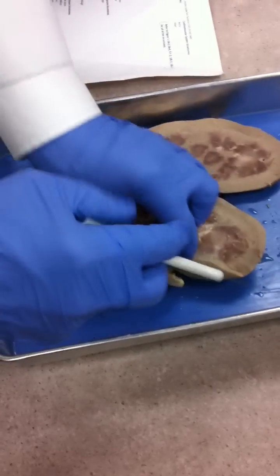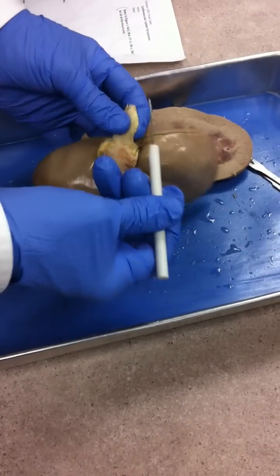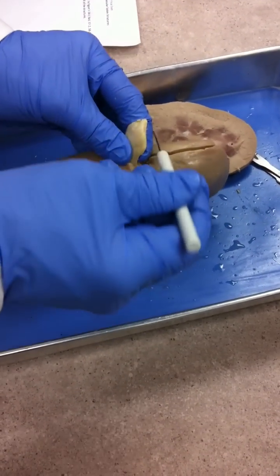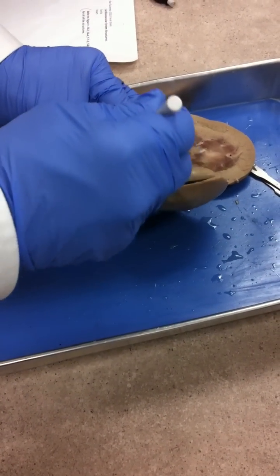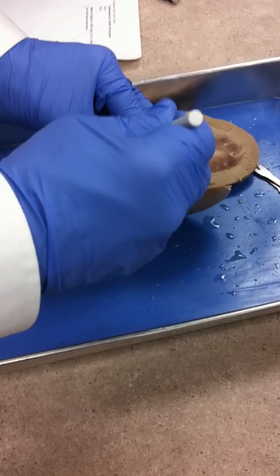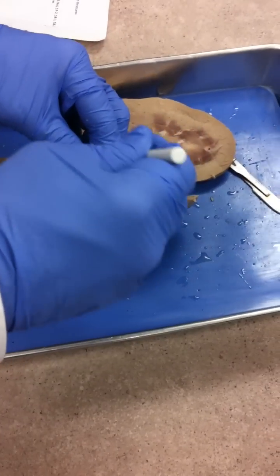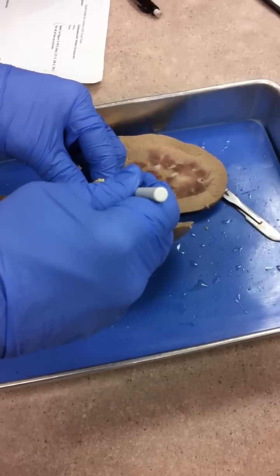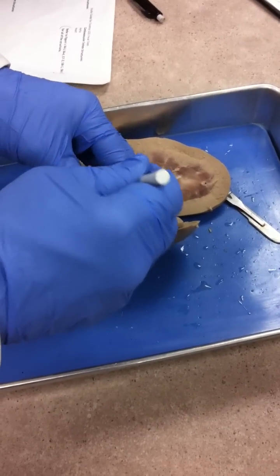Now this is a kidney. Right here, when you see all this fatty type of material, this hole here — I can stick a probe in there. That's the ureter. That'll be one pin.